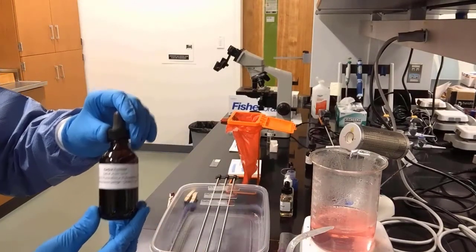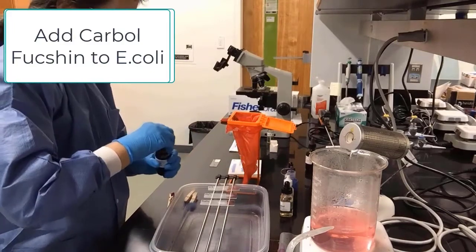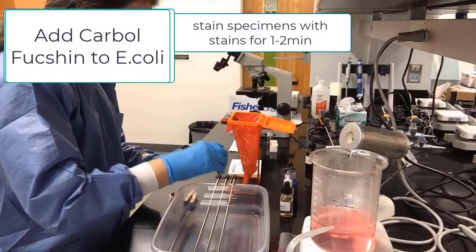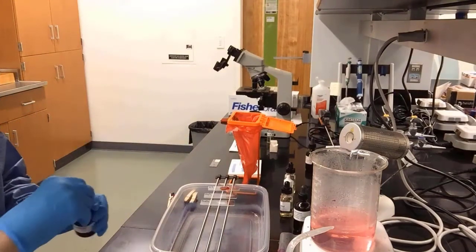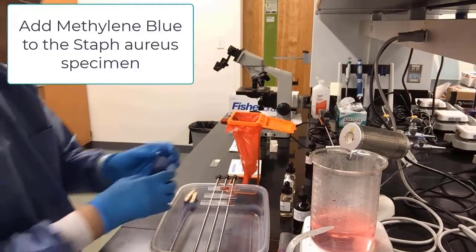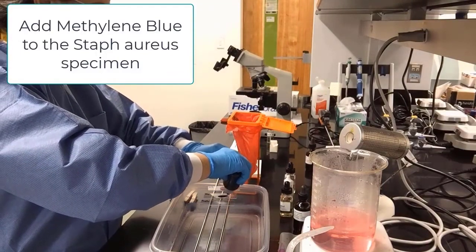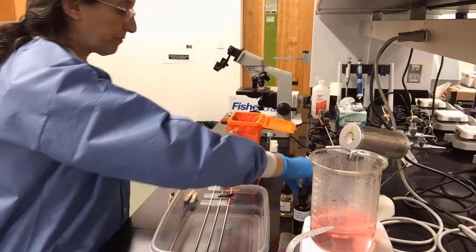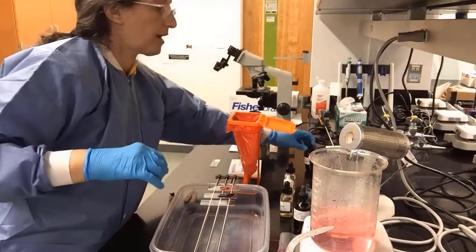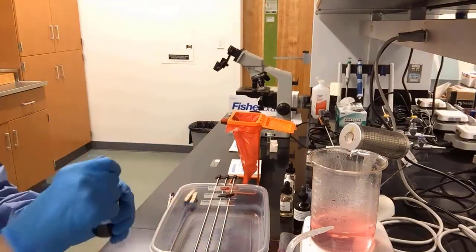We have chosen carbol fuchsin for the E. coli, so we will flood the E. coli smear for about 1 to 2 minutes with carbol fuchsin. We will choose methylene blue for the Staph aureus specimen. Again, we will flood the specimen smear with methylene blue. And now we will use crystal violet for our Bacillus cereus sample.